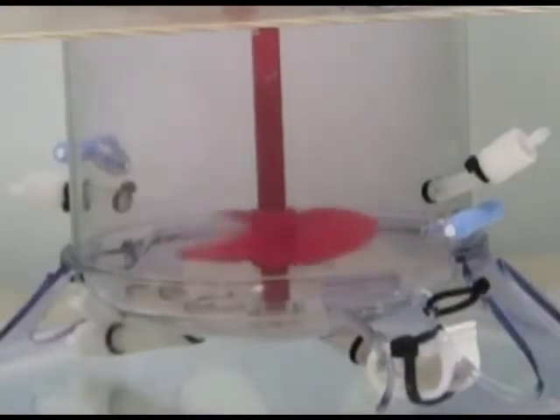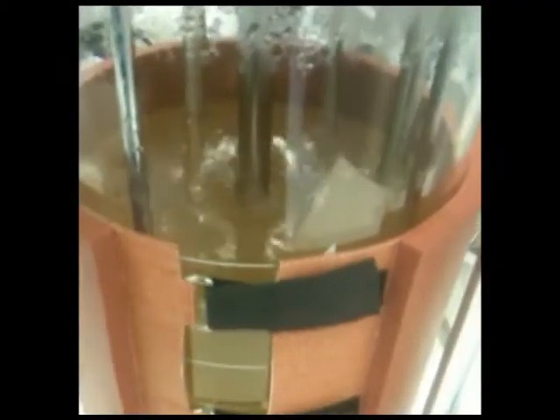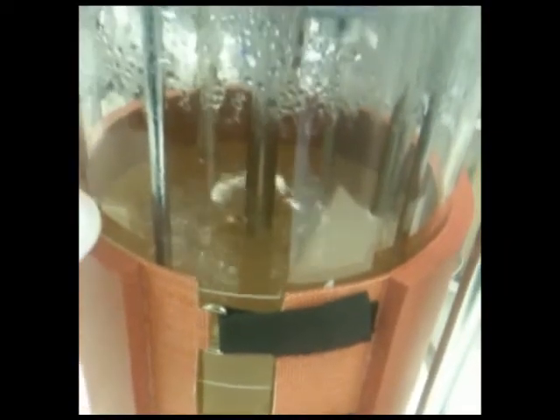The use of impellers to mix the contents of the vessel means it's crucial to understand the turbulence and forces created by the rotating impellers, in order to discover any stagnant zones or shear stresses.